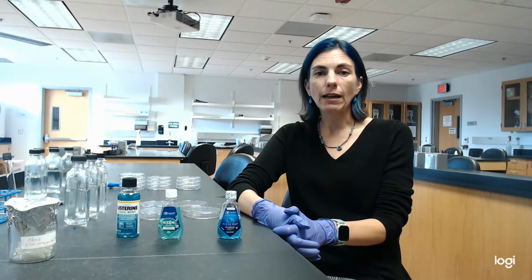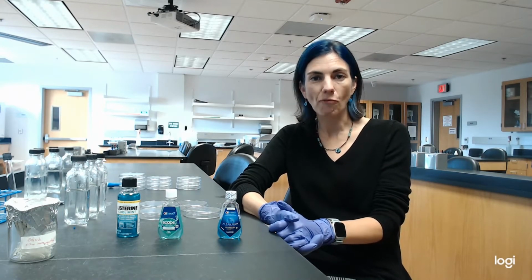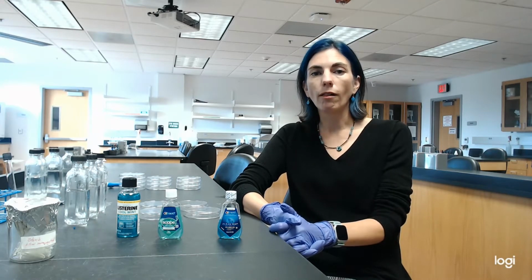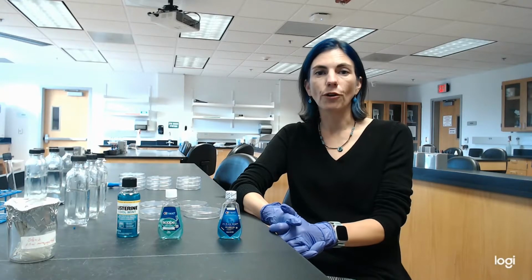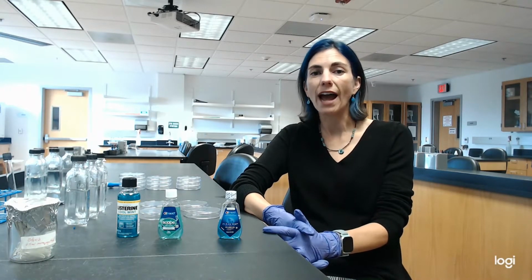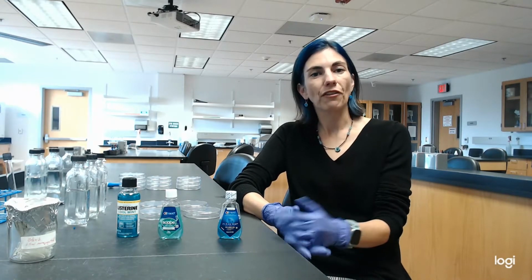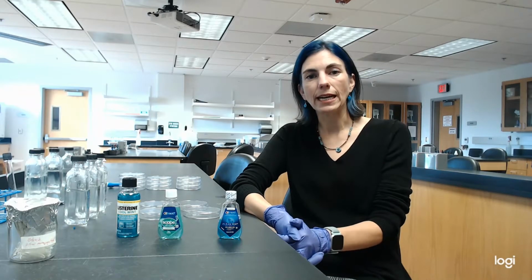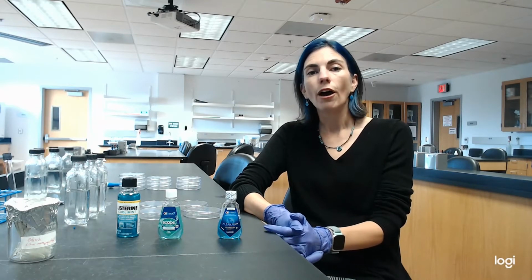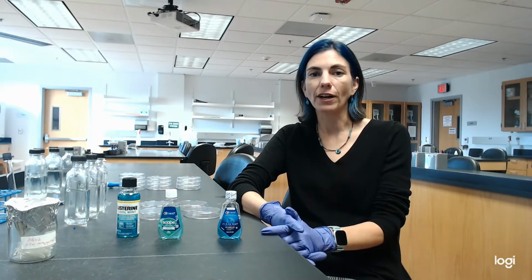Now, even though my saliva probably has hundreds of different species of microbes in it, not all of the microbes will be cultured here. So viruses, for instance, won't, and then some of the bacteria won't grow in agar either. We haven't been able to get them to grow in agar. So understand that the number of microbes that you see in the control plates is actually lower than the total number of microbes that would be in my saliva.